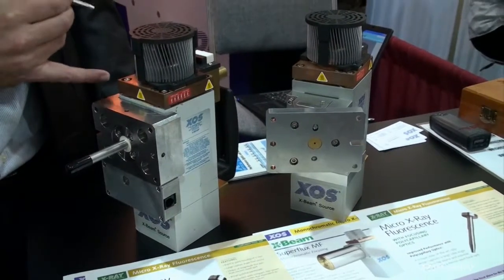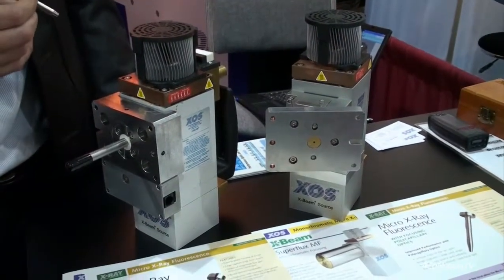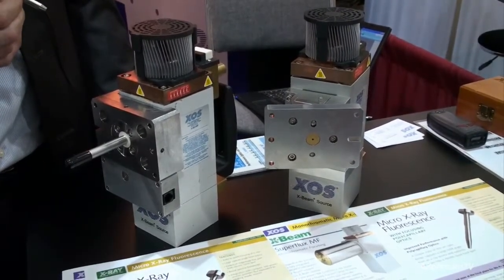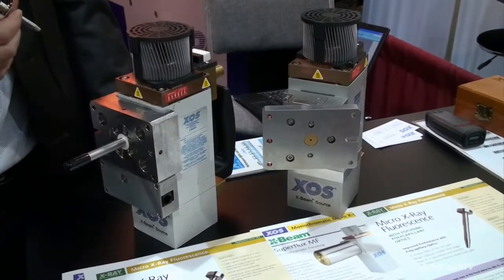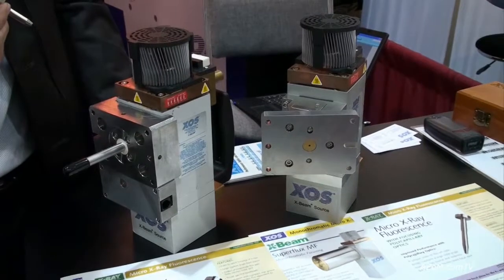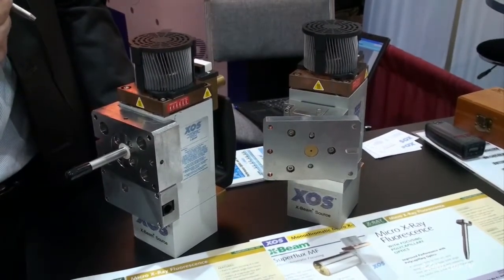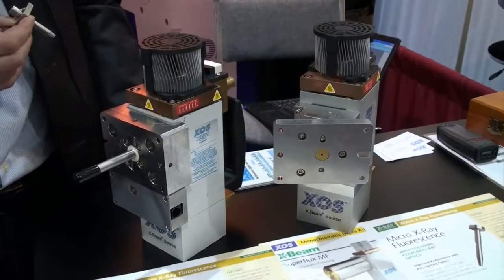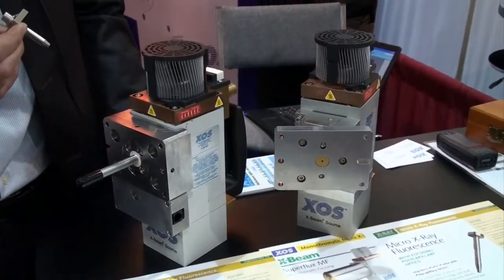The X-Ray tube generates the X-Ray and is typically a low power tube — let's say a 50 watt or a 100 watt type. This entire system, which includes a filter module and a shutter module, would be used as an excitation system in an XRF system or as an excitation system in a diffraction system.